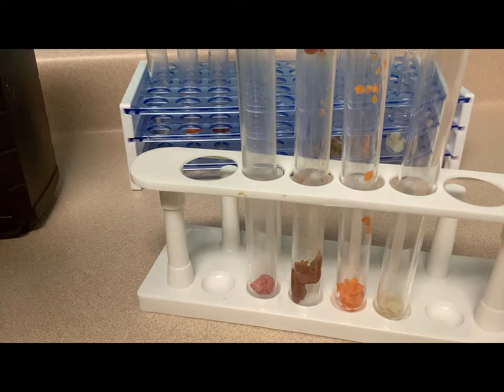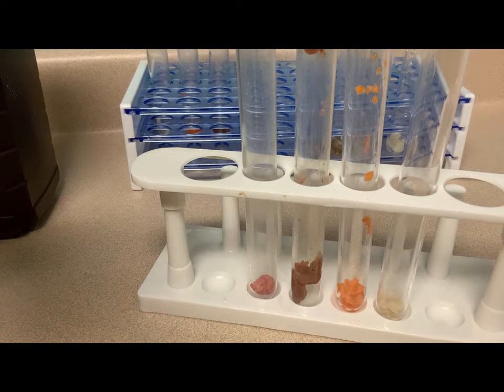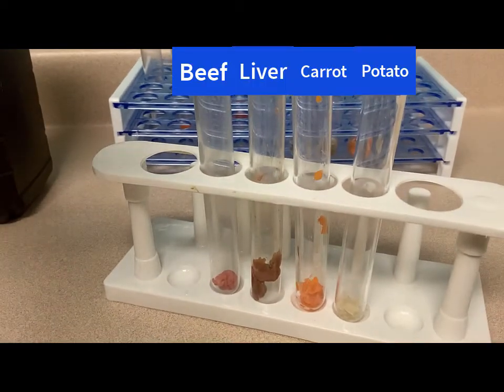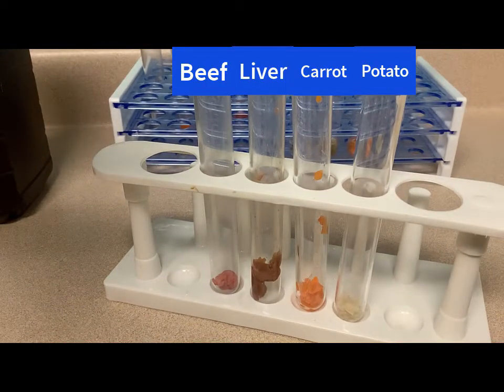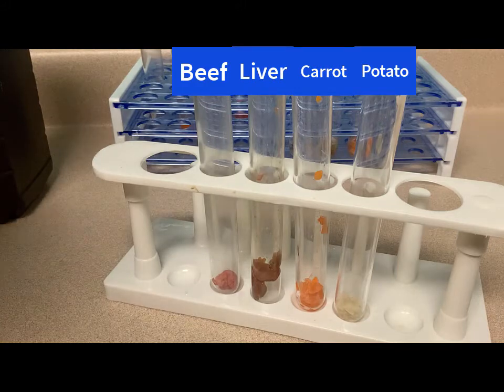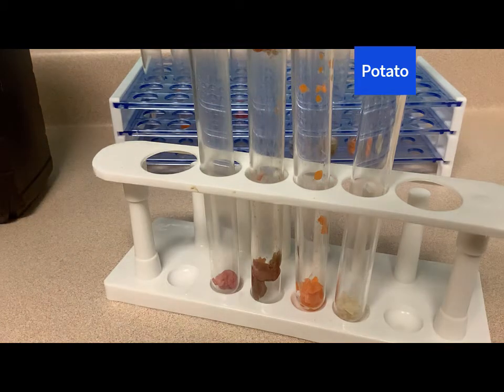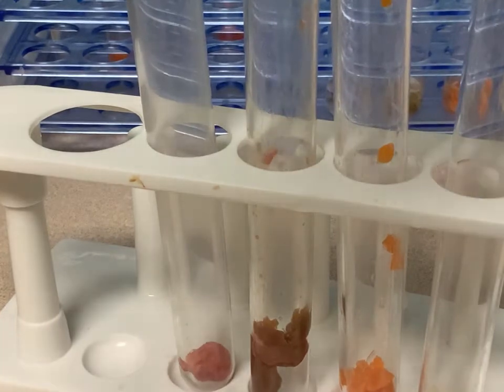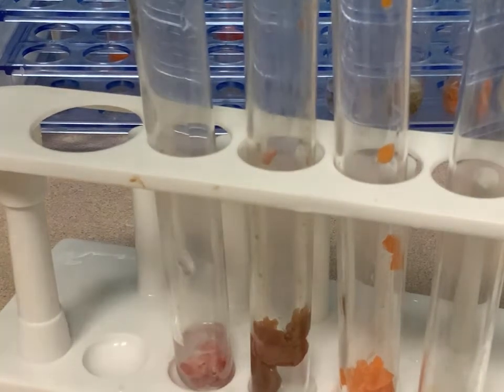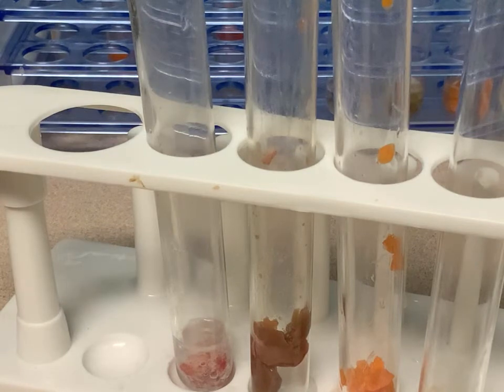In these test tubes are one gram of each: ground beef, finely chopped liver, chopped carrots, and chopped fresh potatoes. Then we combine these tissues with one milliliter of 3% hydrogen peroxide. Look what happens.